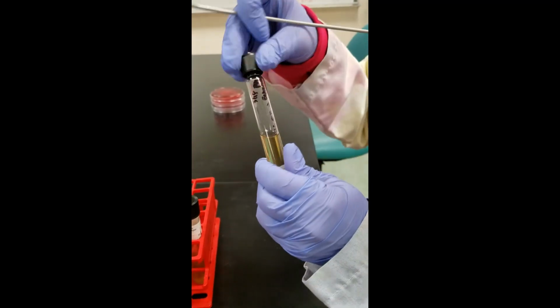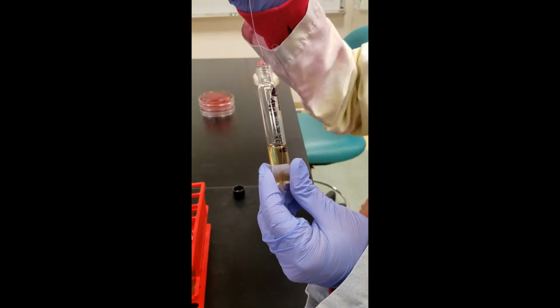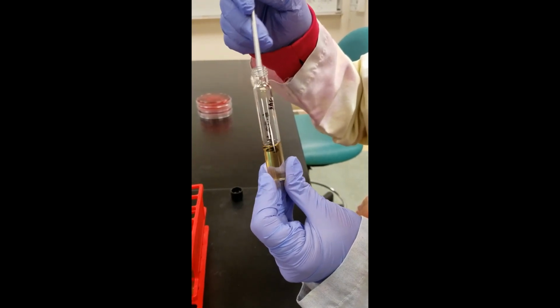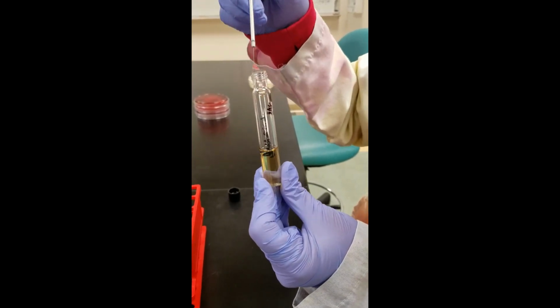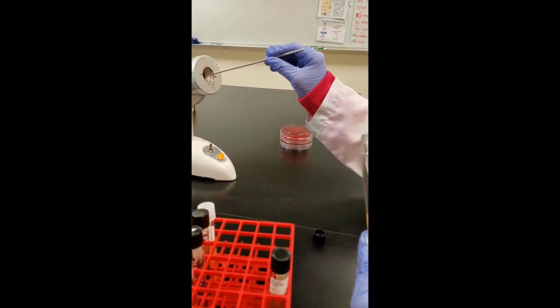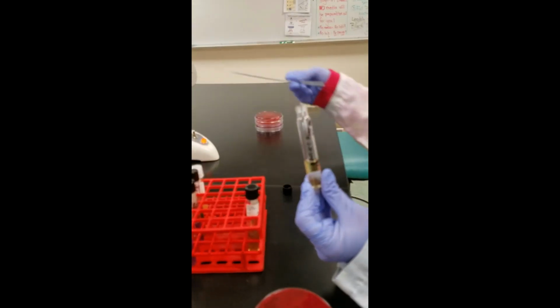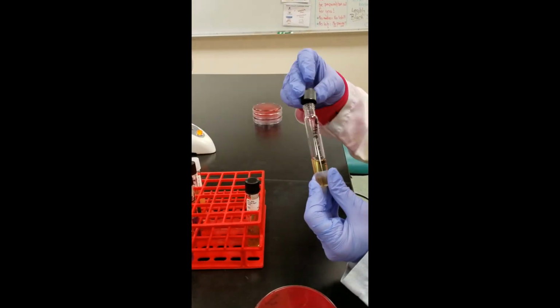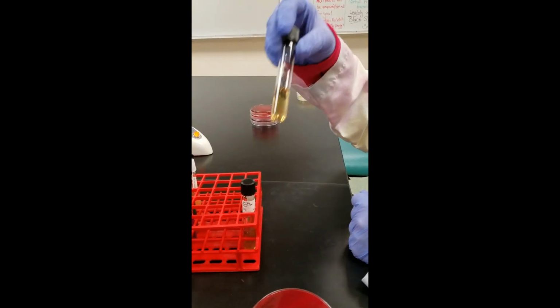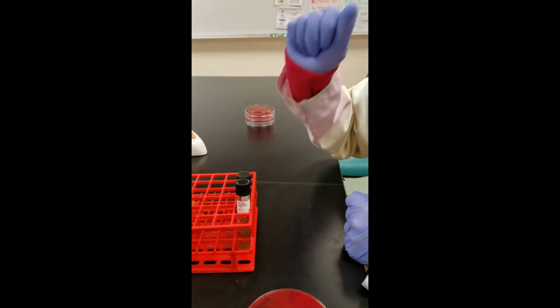And this is a sodium chloride broth. That's a 6.5% sodium chloride broth. That's a lot of salt. I'm just adding some bacteria to the broth. I swirl it around to make sure some of the bacteria get off of the loop. It's not going to look very cloudy because what we're looking for is to see if our bacteria, our enterococcus, can grow in that high salt content. If it can, in the incubator for 24 hours, we're going to see a nice cloudy look to it. So right now it doesn't look like a lot of bacteria, but enterococcus should show us some bacteria.